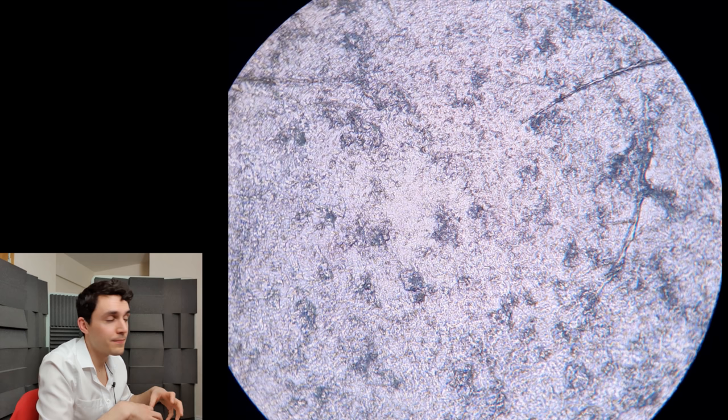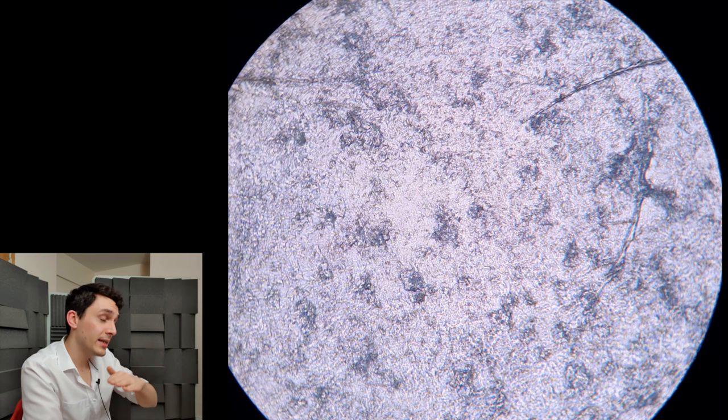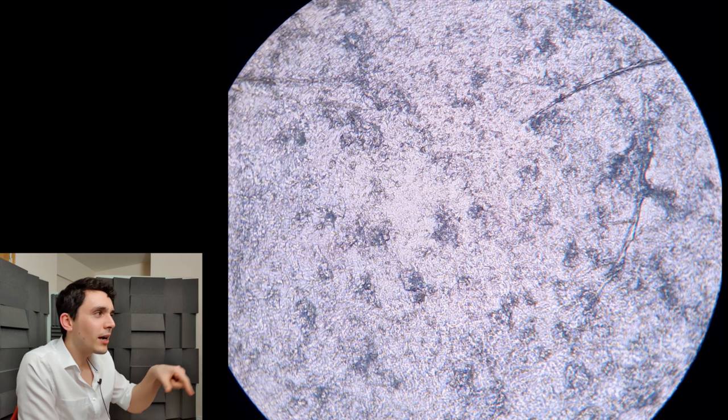Now what you can see here basically is just a mess. This is a part of the slide which contains a lot of dead skin debris — the potassium hydroxide hasn't managed to clear it because it's been spread too thickly. And yet, can you see anything in this image? On the right-hand side, can you see those kind of filaments? They look like little hairs. What is that? Let's take a closer look.